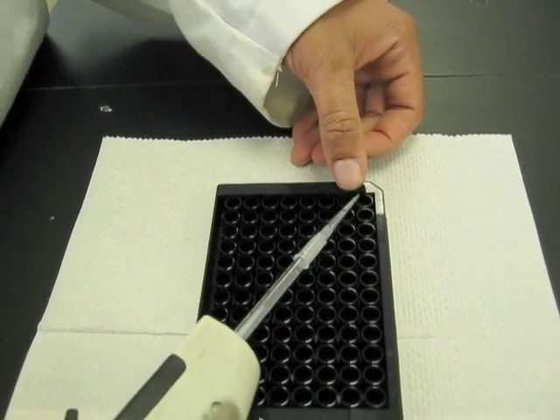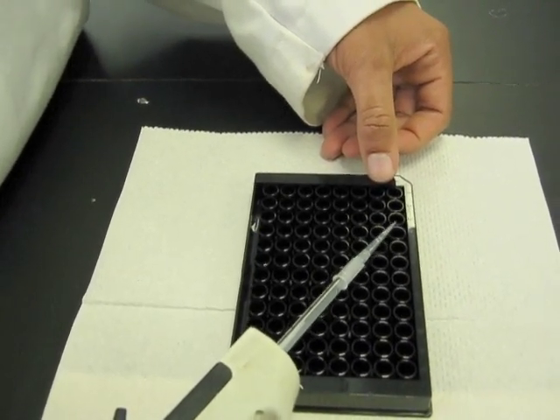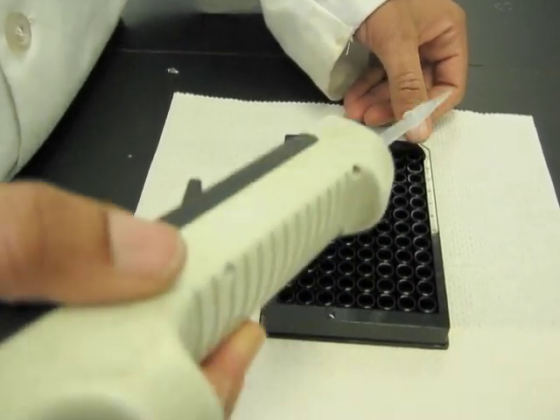Now, you're going to make sure that you add to each well and not beside the well. Also, you're going to have your lab partner keep track of which well you've added so that you don't repeat adding to the same well.